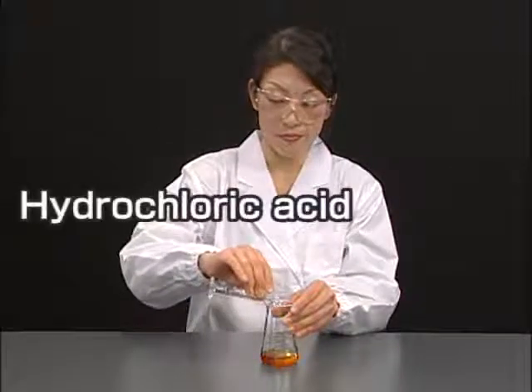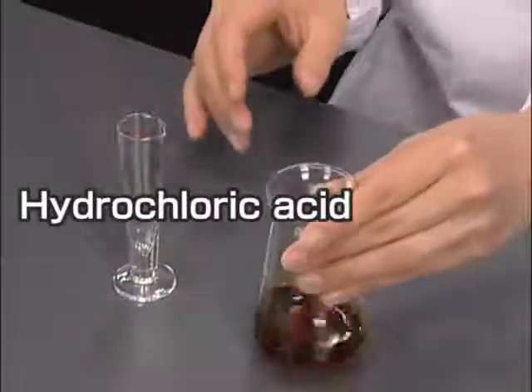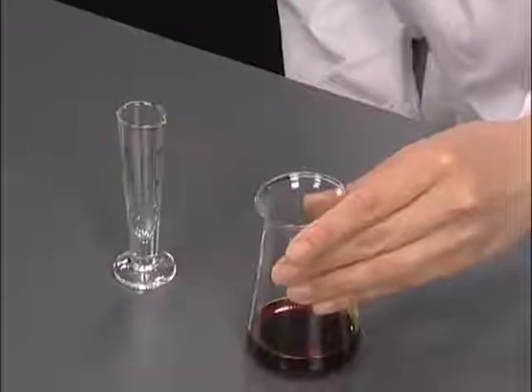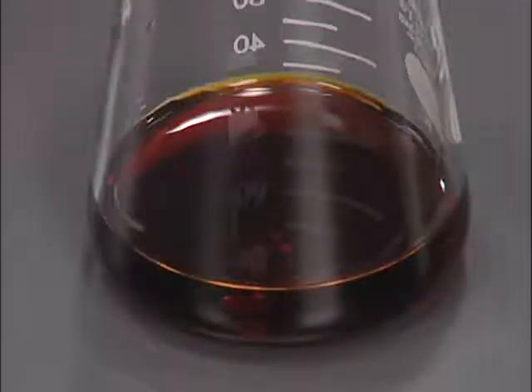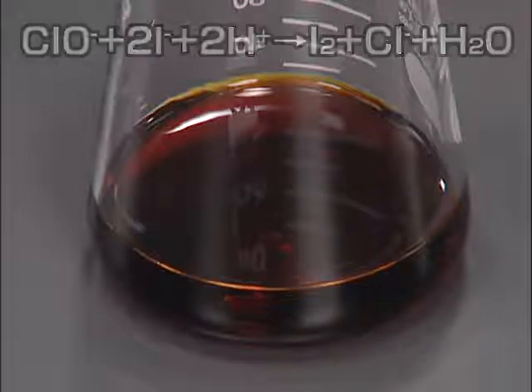Next, add the prescribed amount of hydrochloric acid. Mix well and then allow to stand for more than 5 minutes. Hydrogen ion as well as iodide ion is necessary for this reaction. If hydrogen ion is insufficient, the hypochlorite ion cannot be completely reduced.